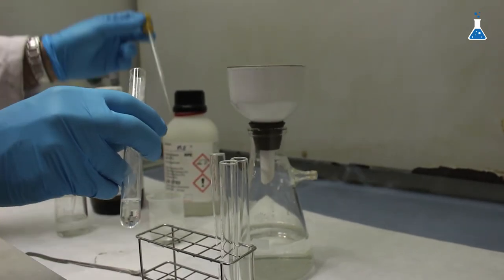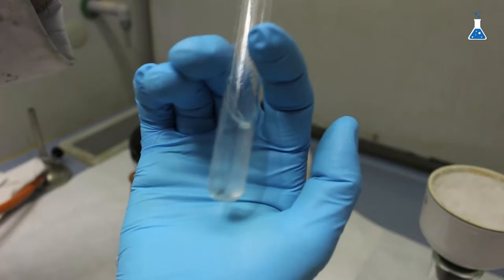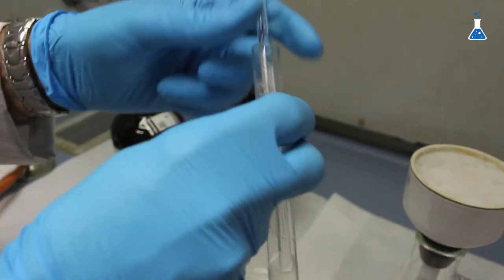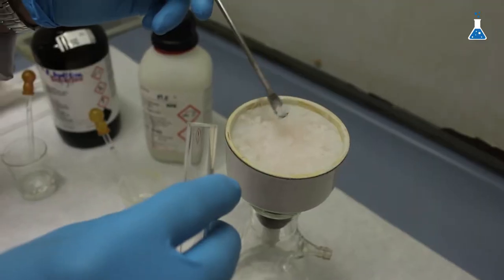Let's start by adding some volume of diluted hydrochloric acid to the first test tube. As you can see, the solid readily dissolves in acid showing that it has a basic behavior in its reaction.